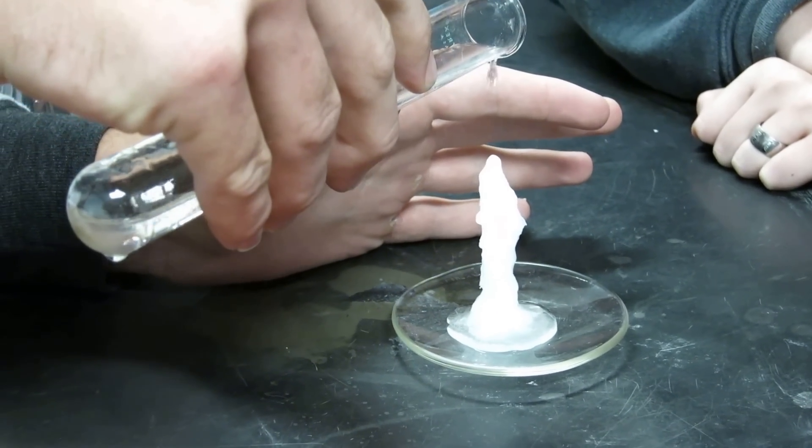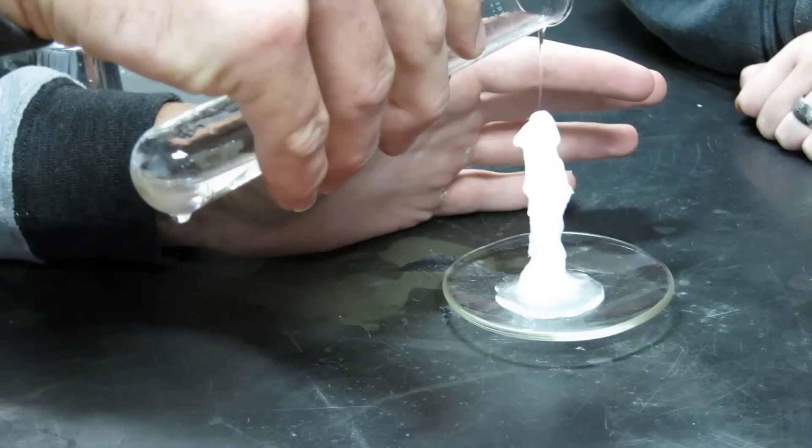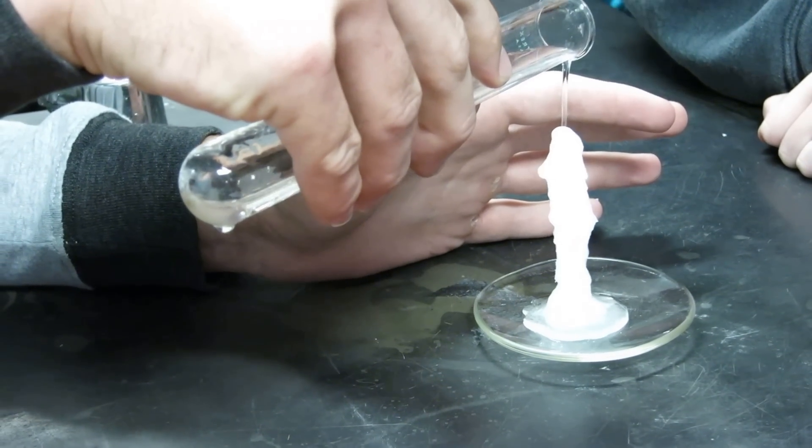Wow, I think it's going to fall over. It's not going to fall over? Uh-uh. Great job.